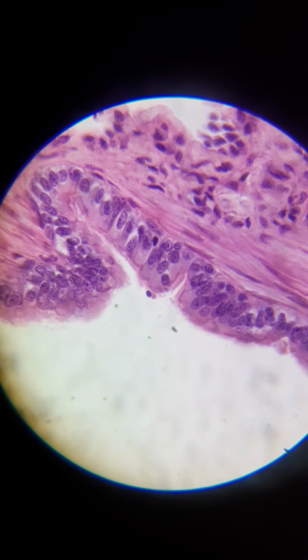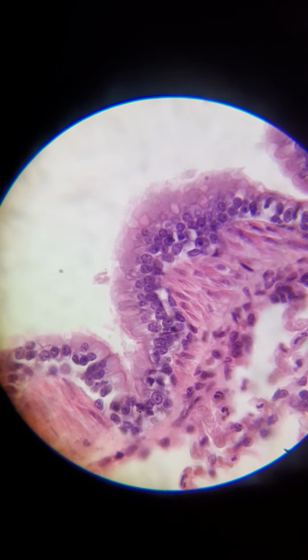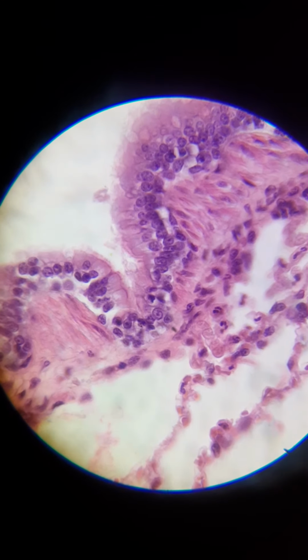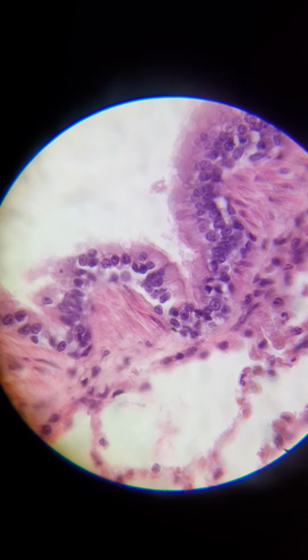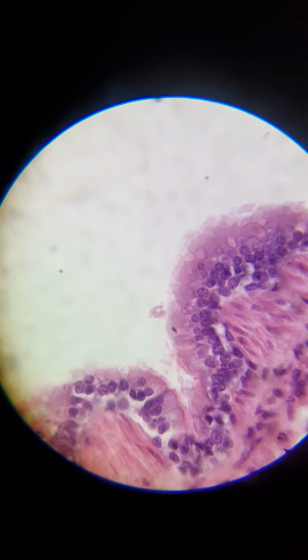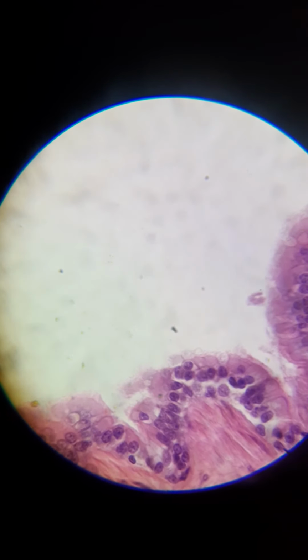And I don't know if you can really see it. Let me find a good spot to really point something out. Oh, I guess kind of right here, actually. So on the edge, I don't know if you can see it, but you see that black dot that's not supposed to be there in the middle of my screen.